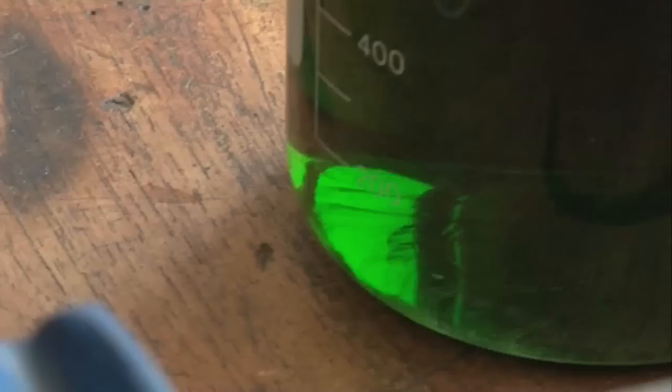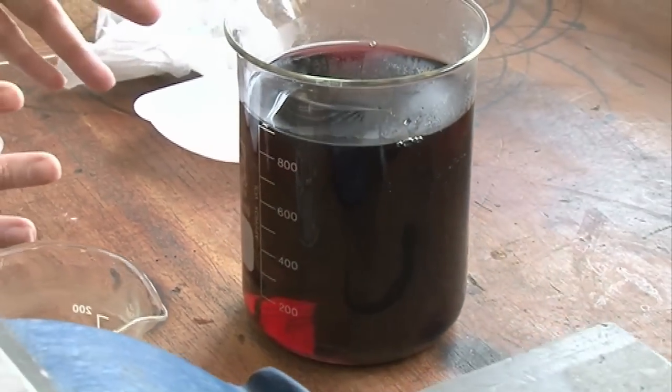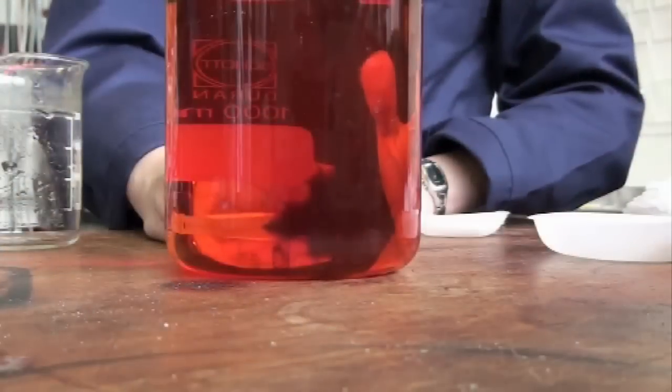Once it goes green it's happy like that, but then it enters a transitional state of red. You've got this red color here and then finally it goes to a nice orange.